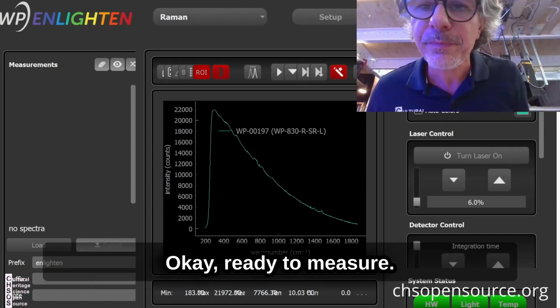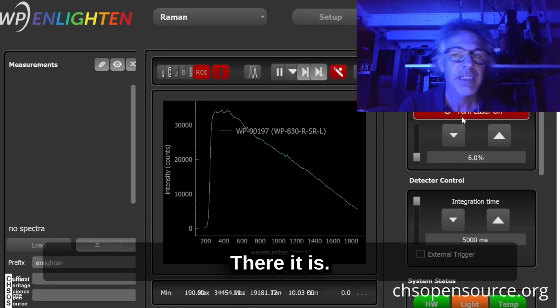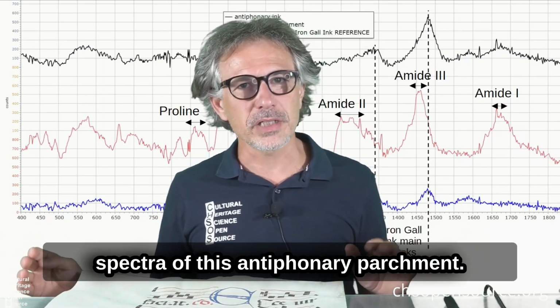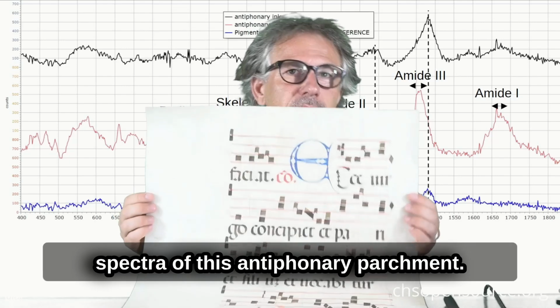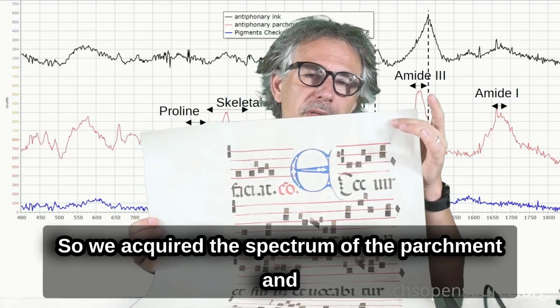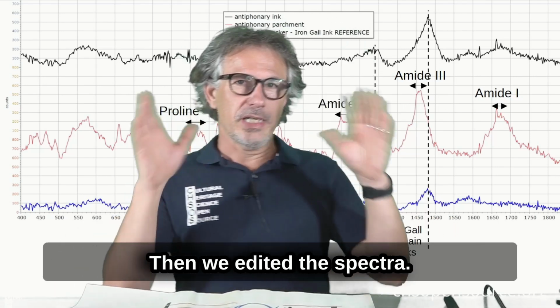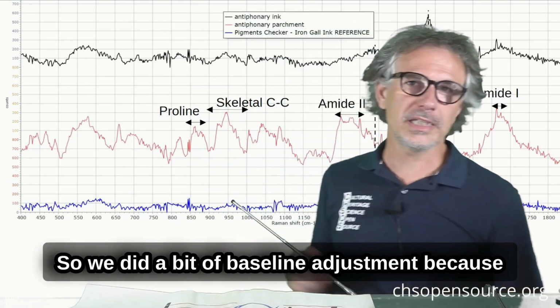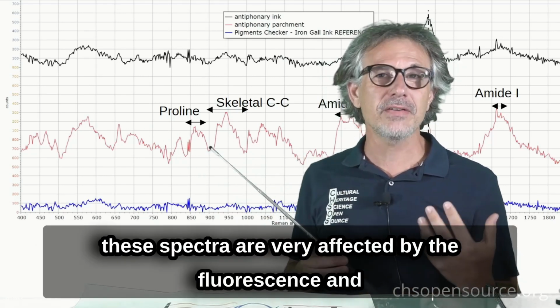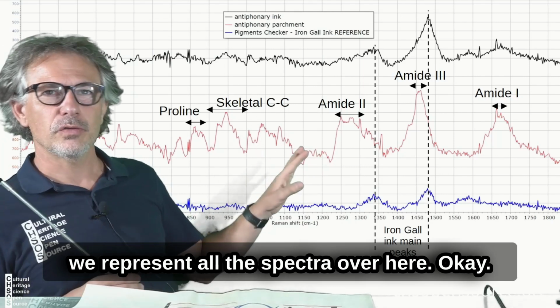Okay, ready to measure. Turn on the laser, and in 5 seconds we should start to see a spectrum. There it is. So this is the spectrum of the paper. We did acquire the Raman spectra of this antiphonary parchment. So we acquired the spectrum of the parchment and the spectrum of the iron gall ink over here. Then we edited the spectra, so we did a bit of baseline adjustment because these spectra are very affected by the fluorescence, and we represent all the spectra over here.